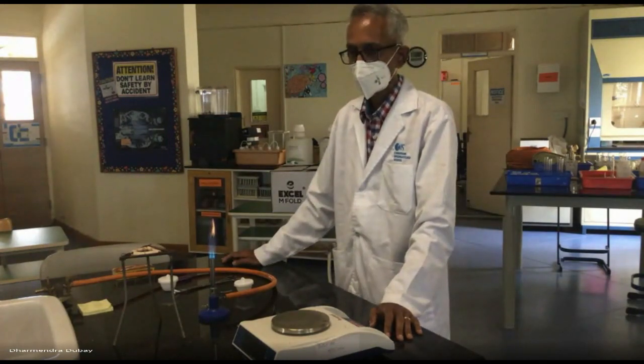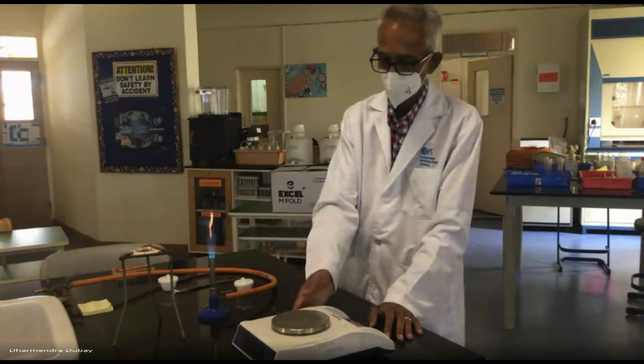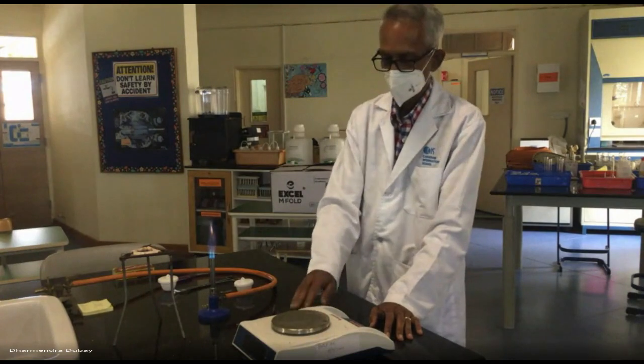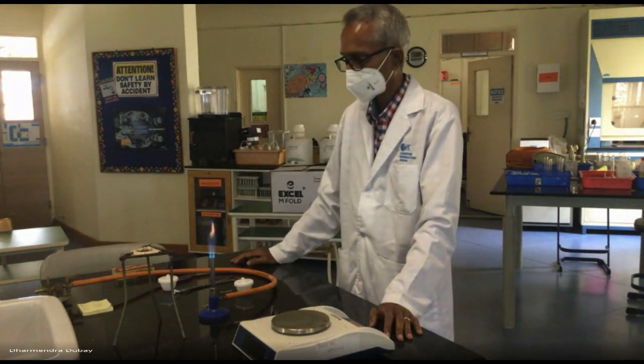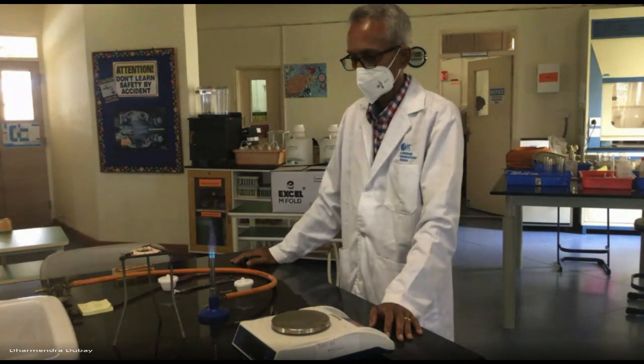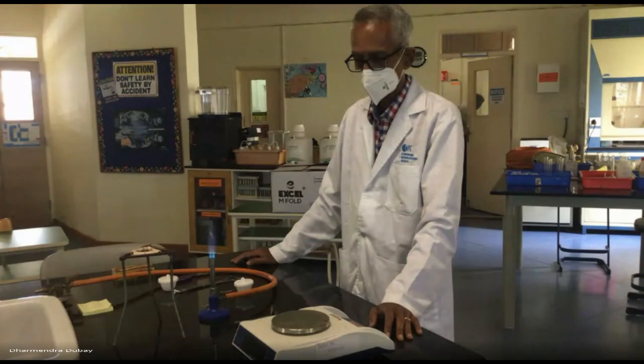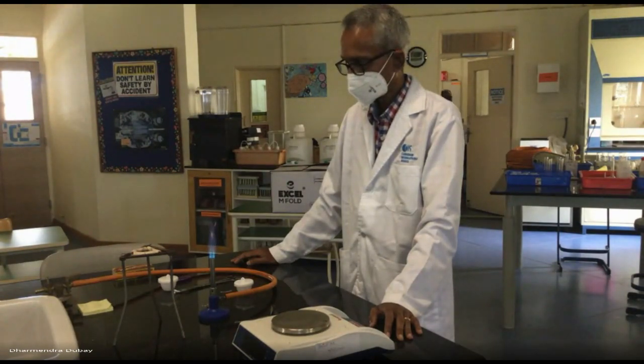That amount of change in mass, we could actually calculate what that change in mass is, and we could then get the atomic mass of oxygen and get moles of oxygen. And on the other side, before we begin, we could get moles of magnesium. And once we have moles of both, then we can put them together and see if the ratio comes one to one.